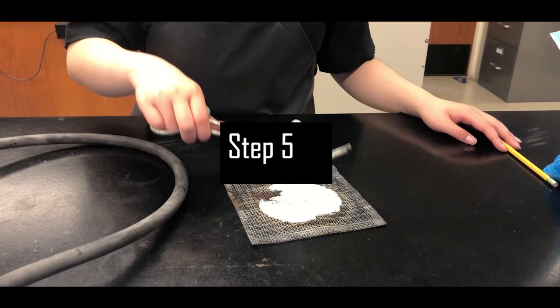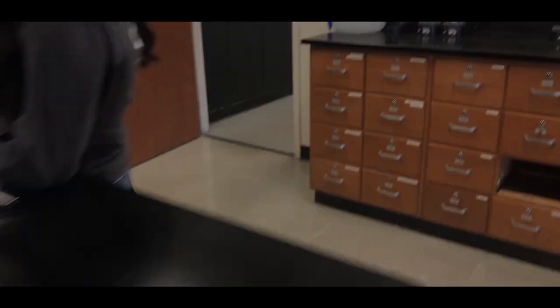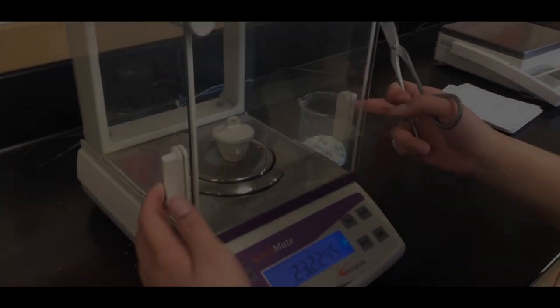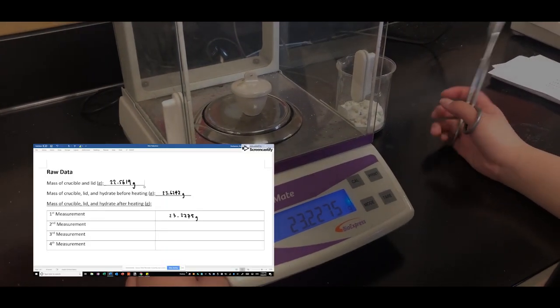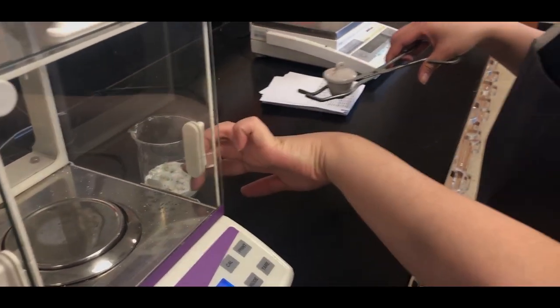After 10 minutes, step 5, use a tong to pick up and place the crucible on top of the wire gauze. Wait until the crucible is cool, then measure and record the mass of the anhydrate. This will be your first mass measurement.